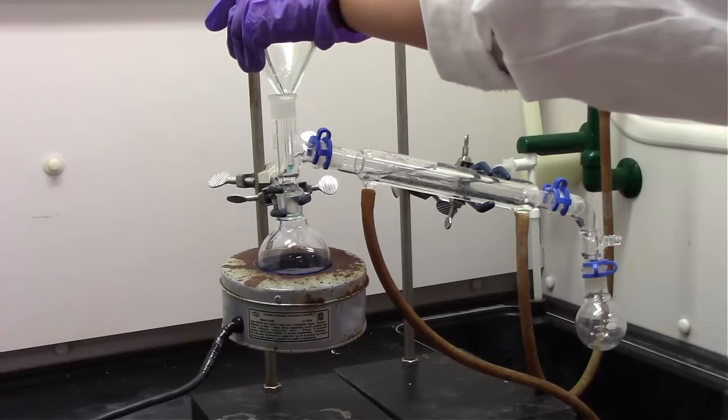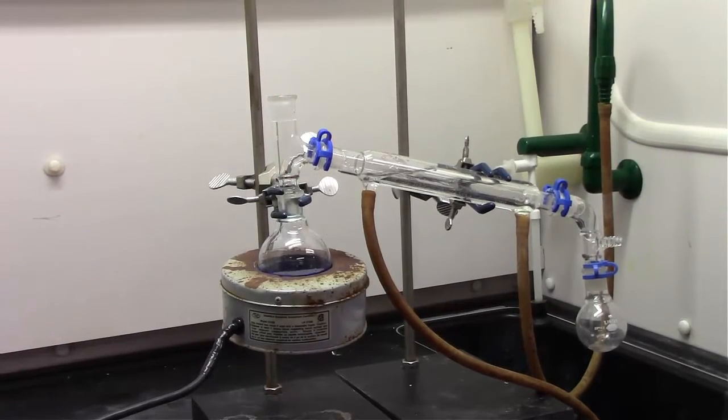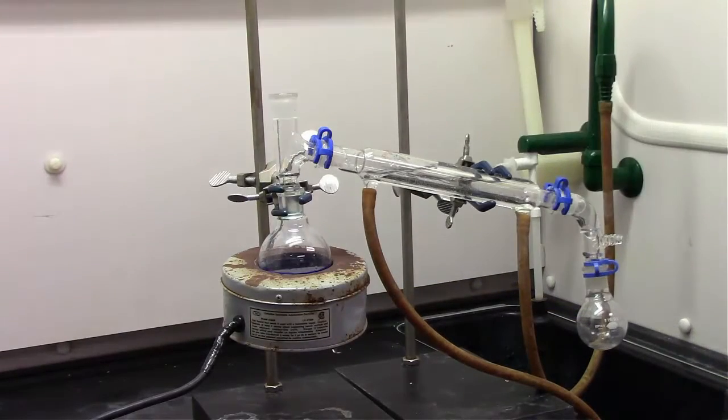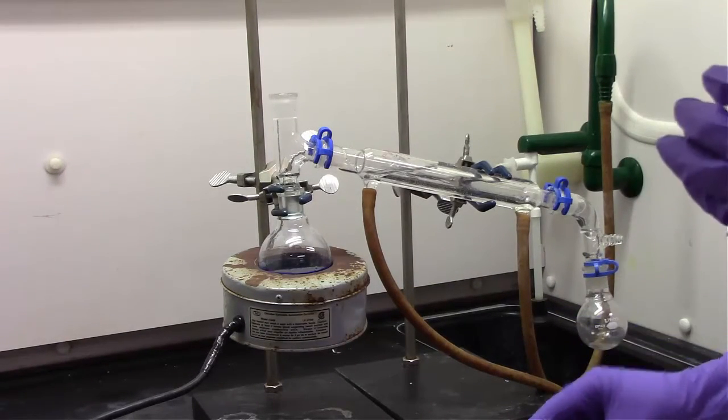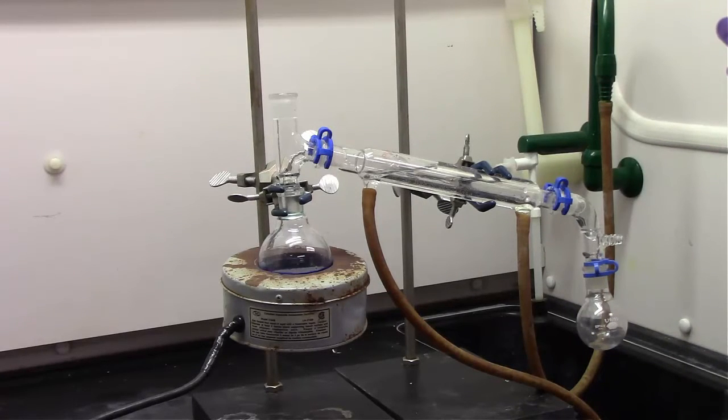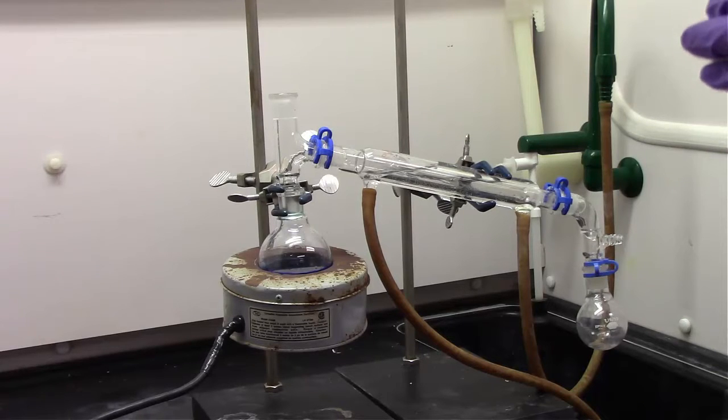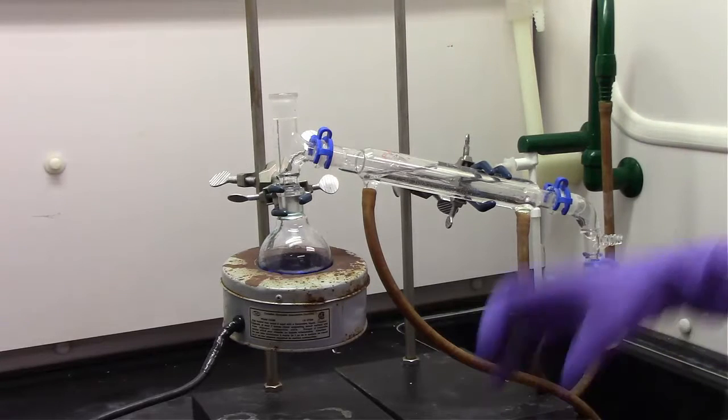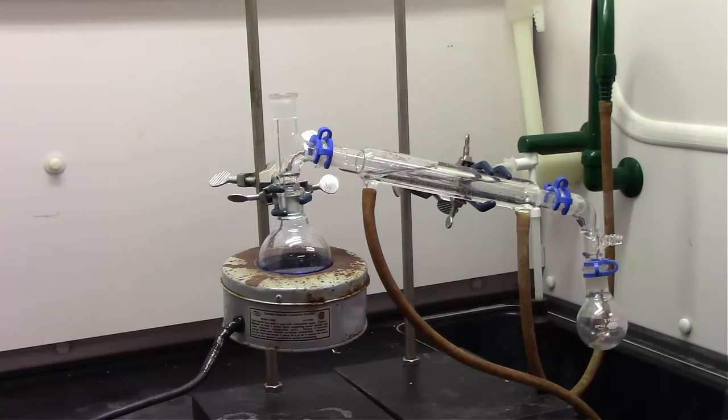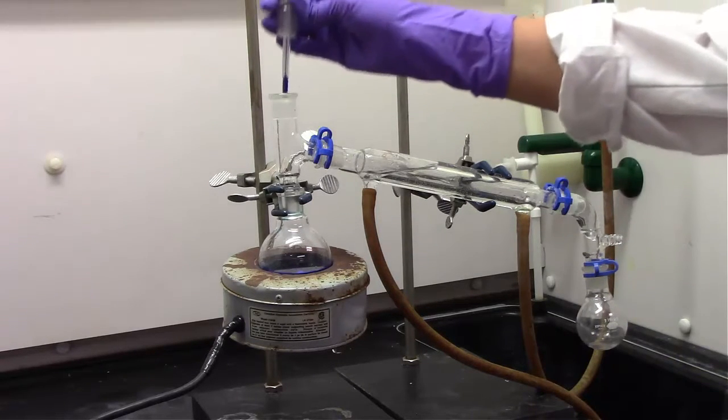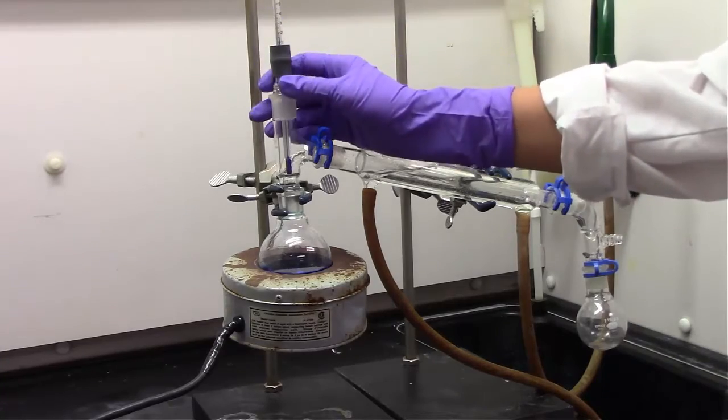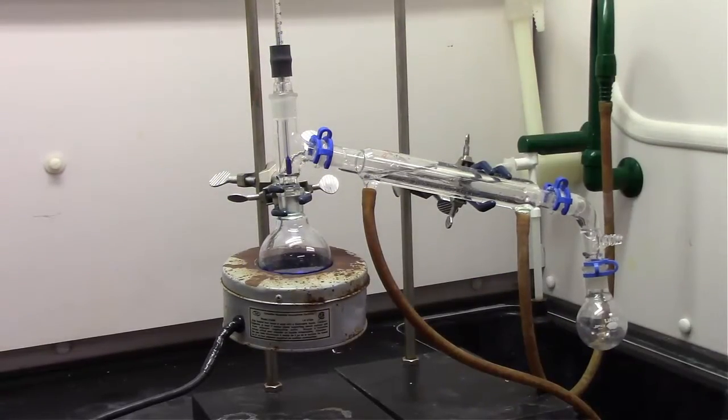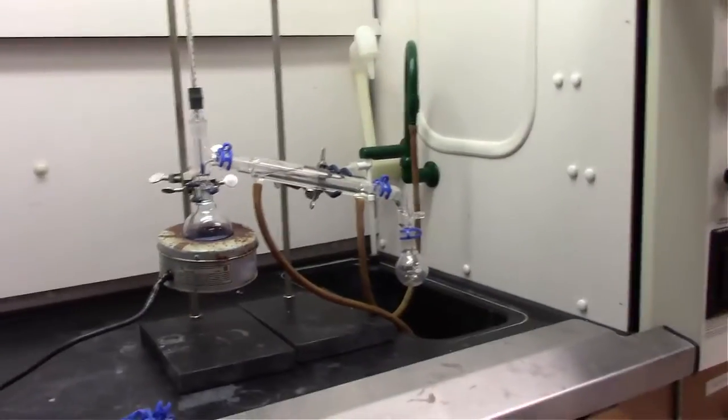With a simple distillation apparatus, we have a heater at the bottom that's plugged into a variac. That heater is heating the 100 milliliter round-bottom flask. Right now, we're going to put a boiling chip in to the solution. That round-bottom flask is attached to a three-way adapter, which then connects to the condenser. The condenser has an inner pipe in it, basically, which allows the liquid that's being condensed to fall into the collection flask, and also an outer area which has the water, which allows the water to flow through it, cooling down that inner area of the tube.